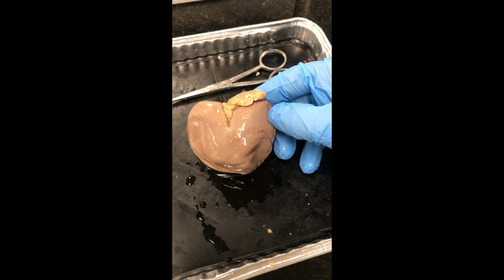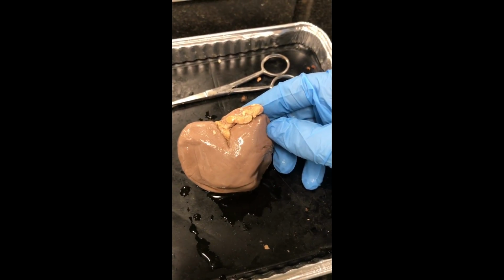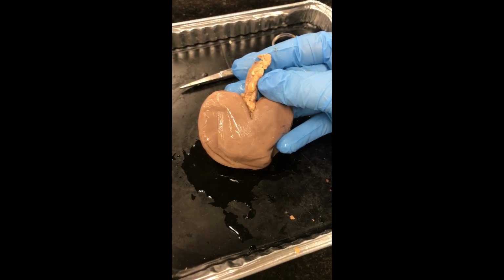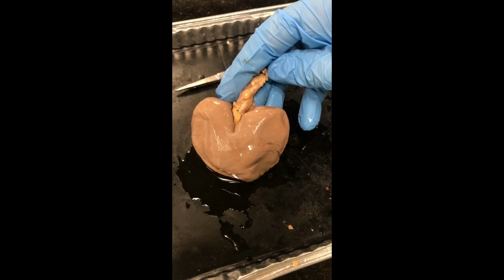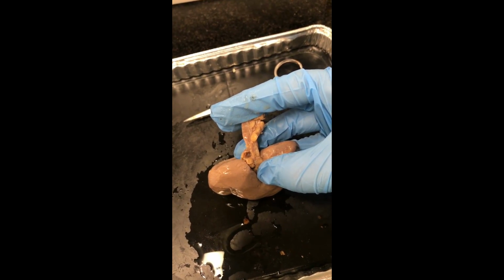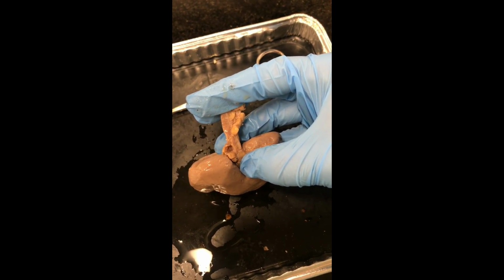In order to protect and maintain the shape of the kidney, the renal capsule is responsible for this, and it also consists of irregular connective tissue. To connect the kidney to the urinary bladder, here is the ureter. The renal artery and the renal vein may be difficult to see just because they were severed very close to the hilus when the kidney was removed.